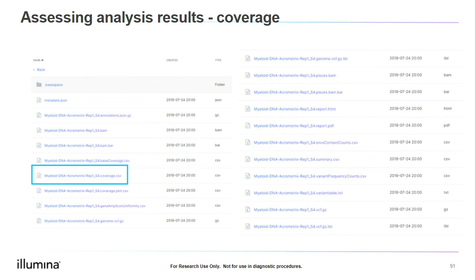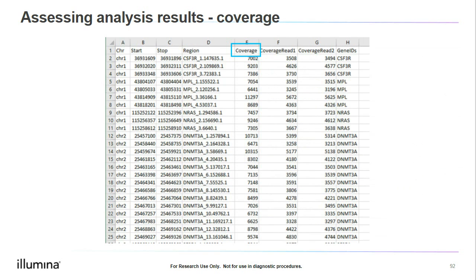The next file we can review is the coverage.csv file. I do not always review this file, though I want to make you aware of it as it can be very useful. When we open this file, we will get a big long list of every single amplicon in our panel. The coverage column, indicated here, lists the number of reads that align to each target amplicon. If you ever see a 0 in the coverage column, that indicates an amplicon dropout, though in this example, we do not have any dropouts.